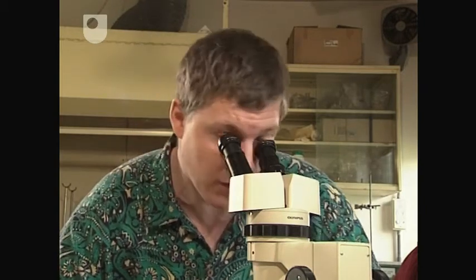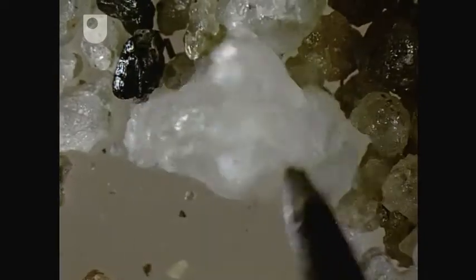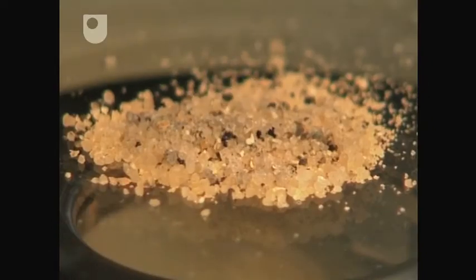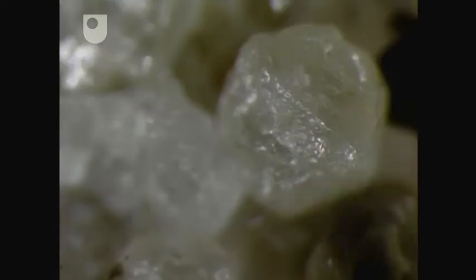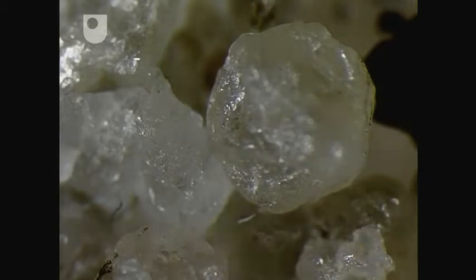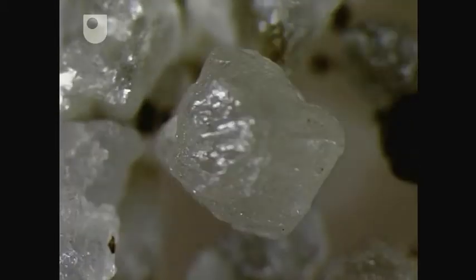If I look at the shapes first of all, I can see that they're very angular. In fact, they're remarkably similar to the angular quartz grains we saw in the granite up on the moor, and that suggests that these quartz grains haven't gone very far. If I look now at the surface textures, they're glassy and reflecting, and that tells me that these quartz grains have been transported by water, because water has cushioned the impacts between the grains.